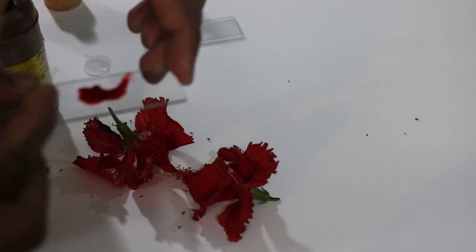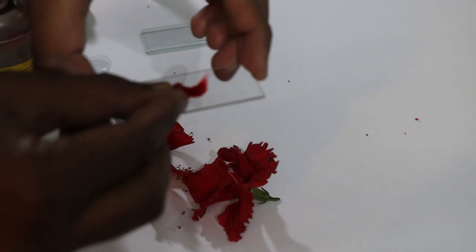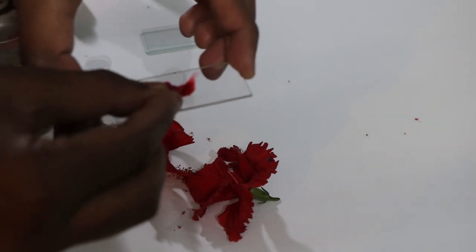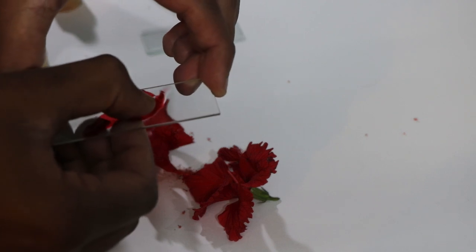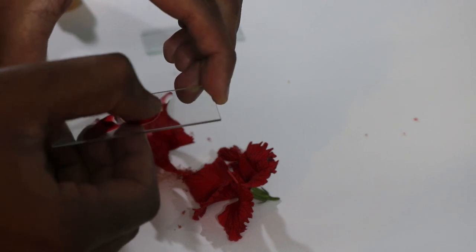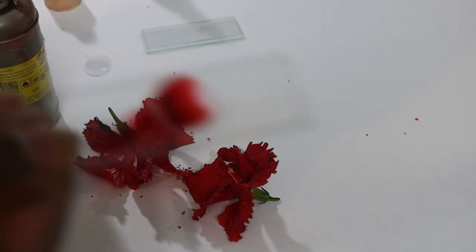Now carefully place the cover slip as shown in the video and put a bit of force on it. Applying force helps in removal of air bubbles.